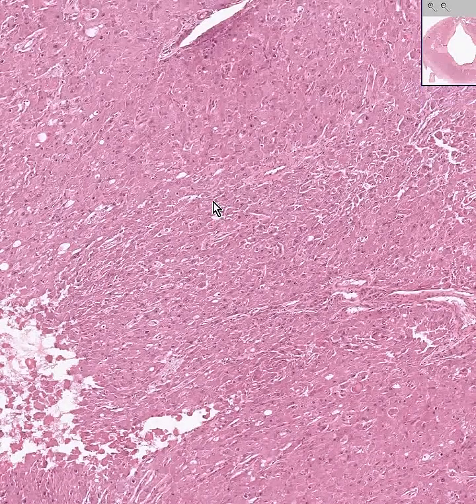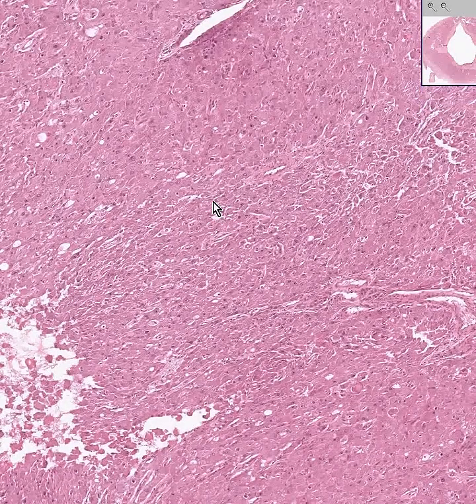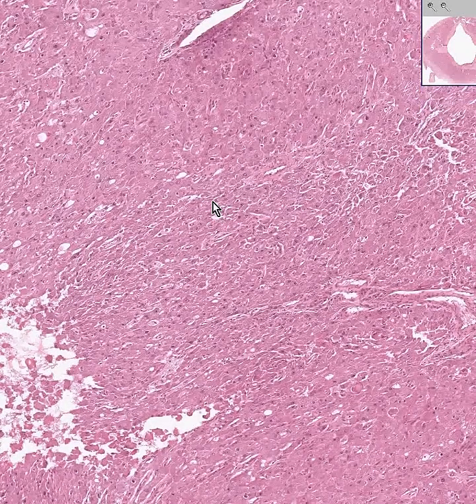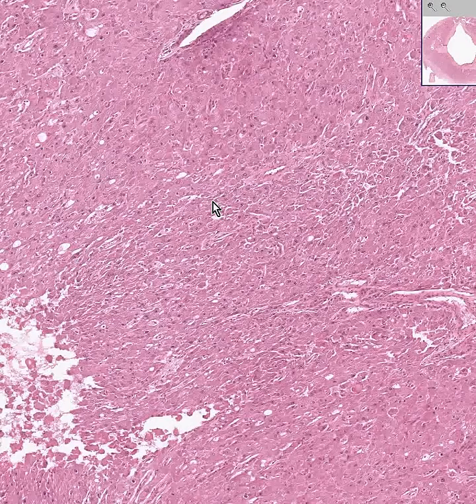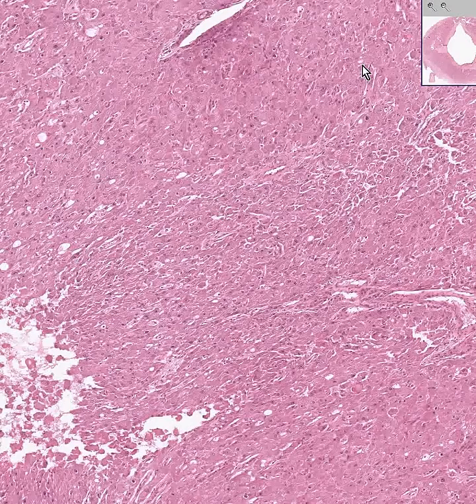It's composed primarily of these very foamy cells, which contain steroid hormones, which is why they always look yellow — which is why it's called corpus luteum, because luteum is the Latin word for yellow.